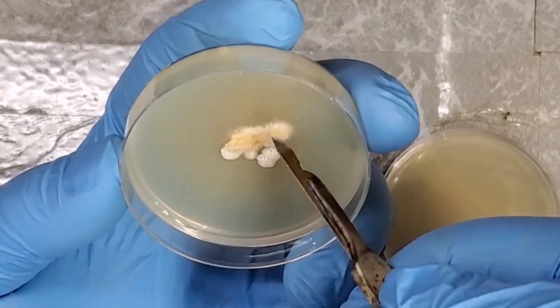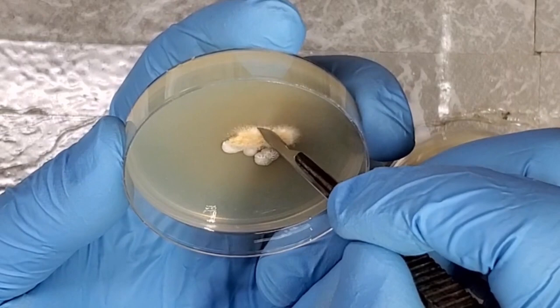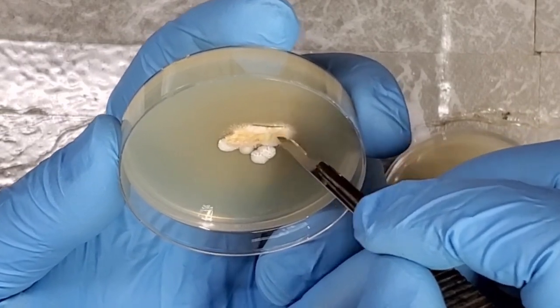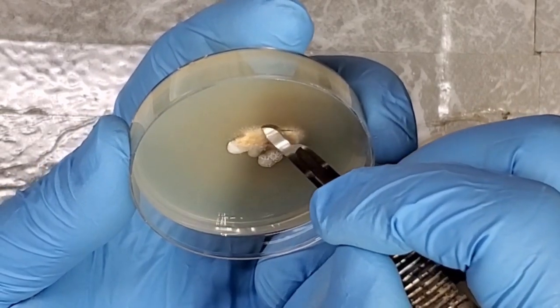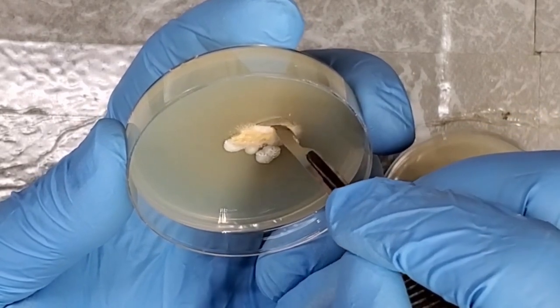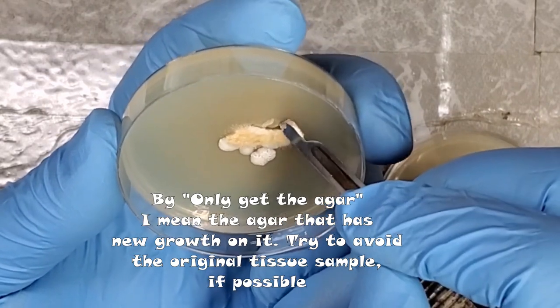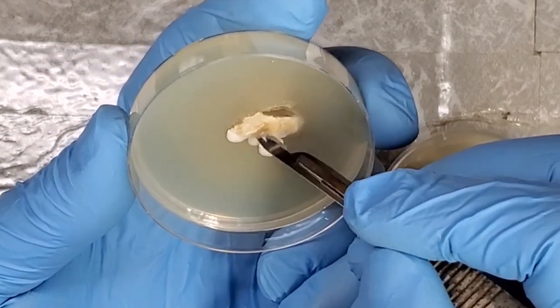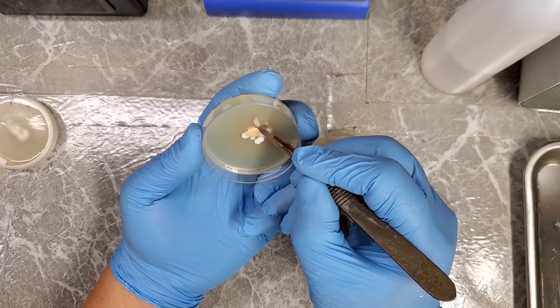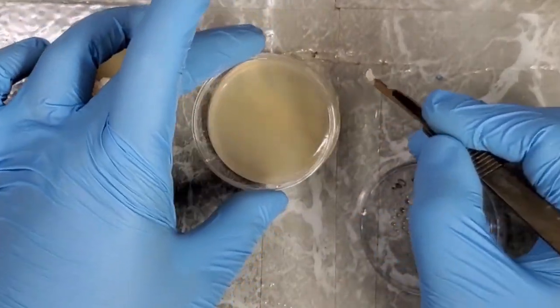So if you have growth like this, the best thing to do in this case is cut a little chunk from the agar. Try, if you can, to only get the agar, like this. See, that wasn't ideal, but it'll get the point across. And then we want to just do that.